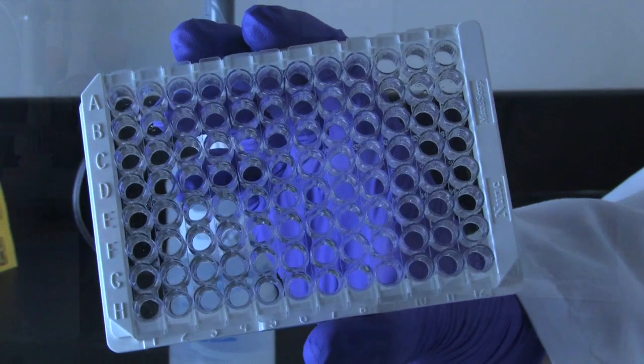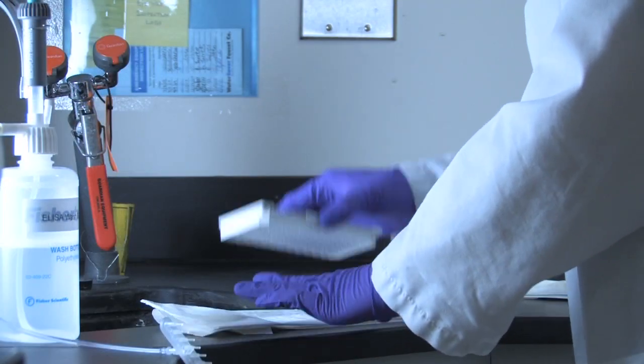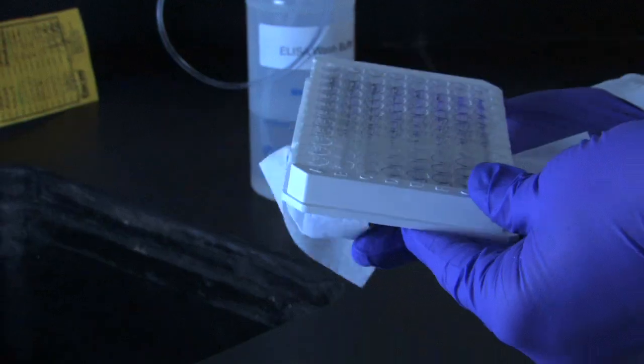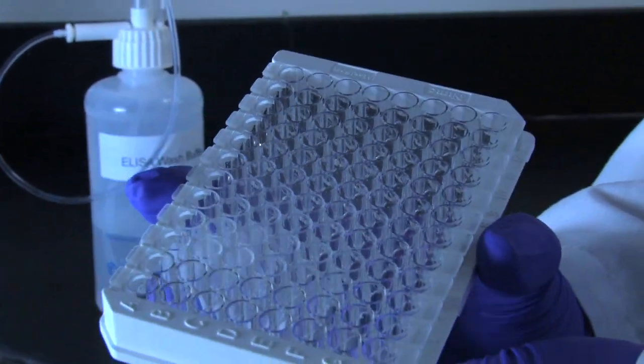Visually inspect the wells for excessive bubbles or residual wash buffer and repeat tapping motion if necessary. Also, make sure to absorb any liquid from the plate frame and outside bottom of the wells before continuing with the next step of the assay.